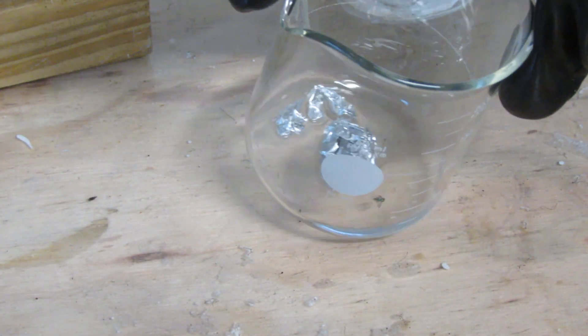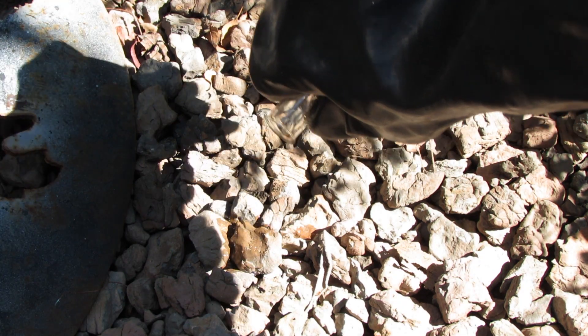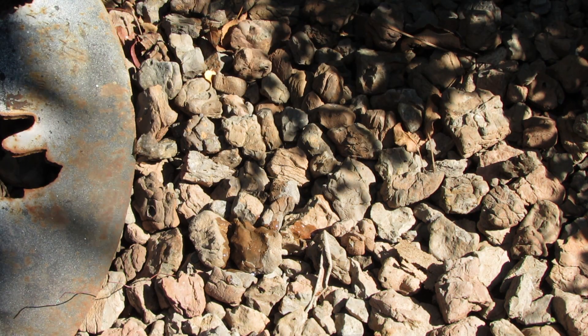I tried reacting the hydrochloric acid with some aluminum, and I tried pouring it on some rocks to see if I could get them to sizzle, but nothing happened.